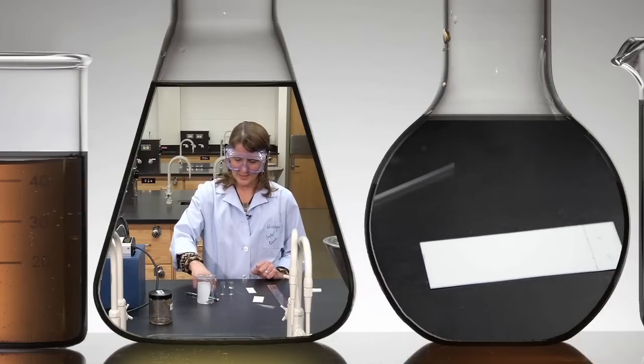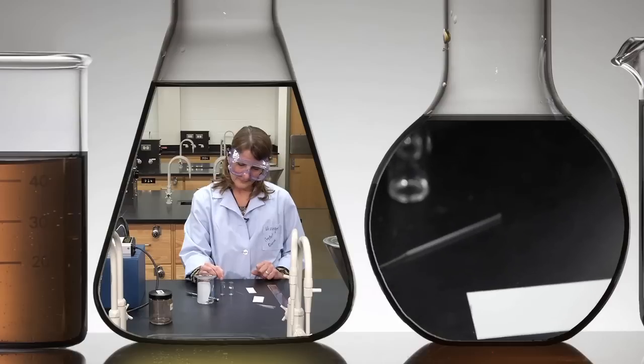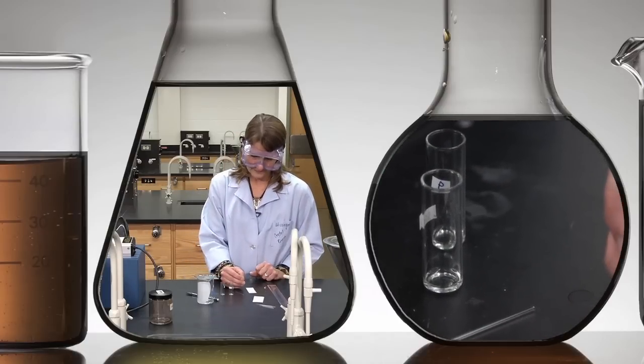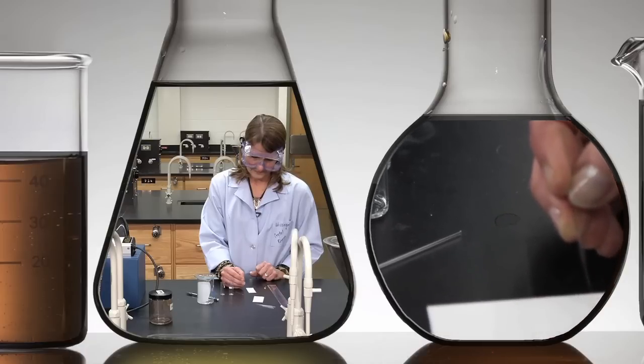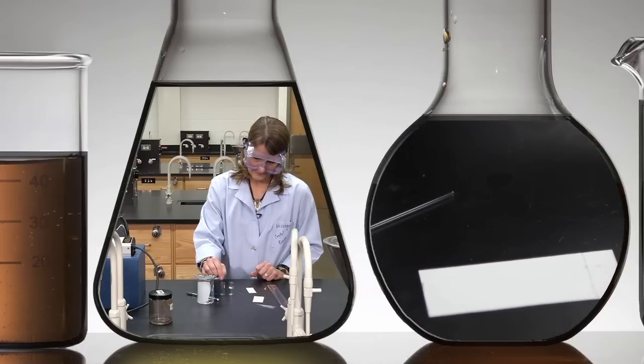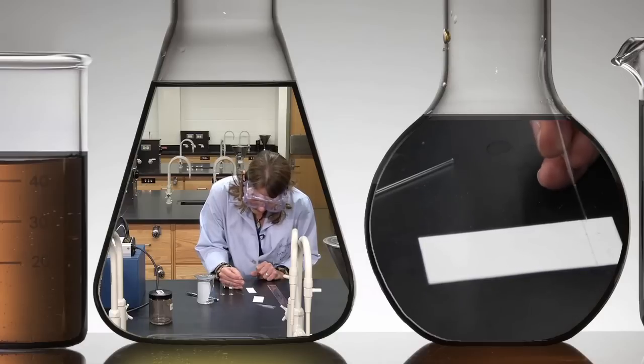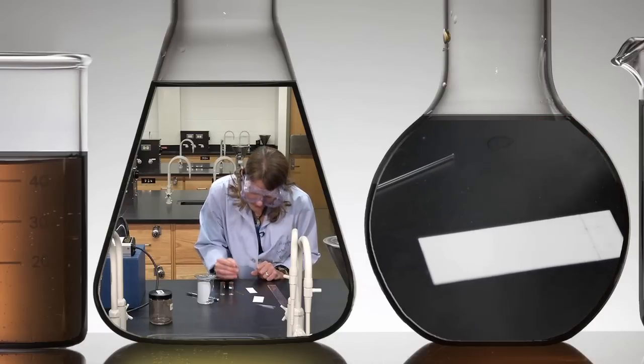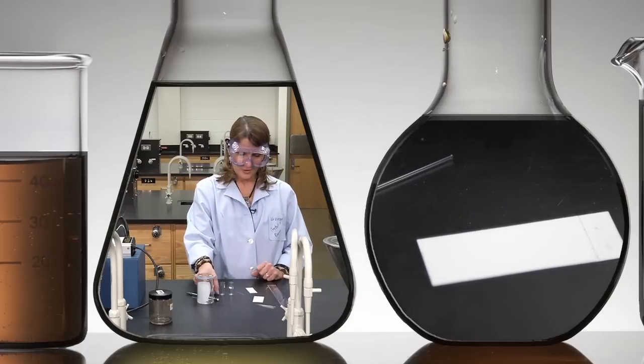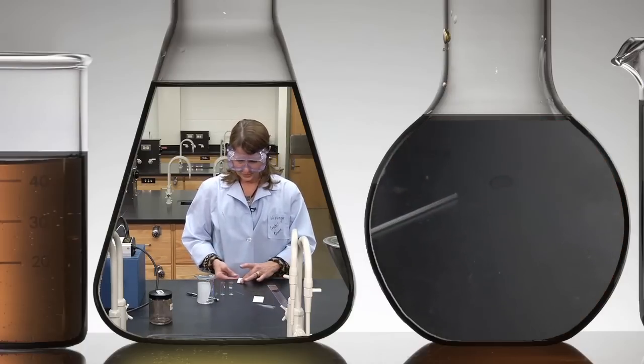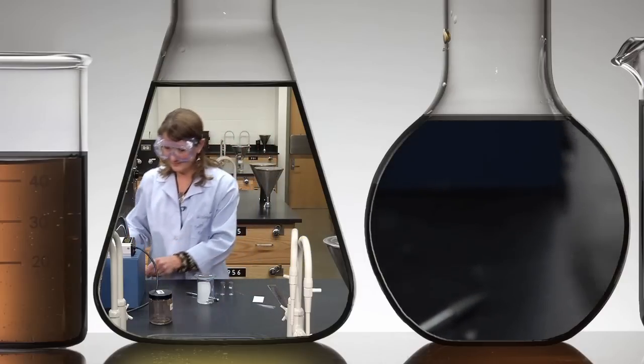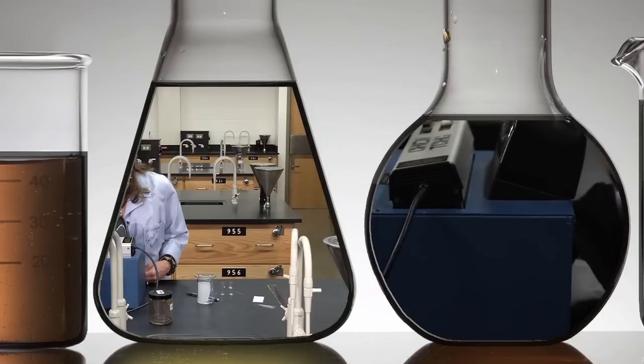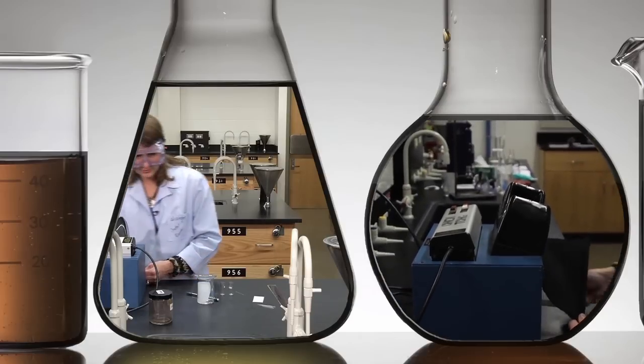I'm now going to spot the product on the plate. Again, I would take it over to the UV lamp and check that I have enough sample on the plate. Looks great.